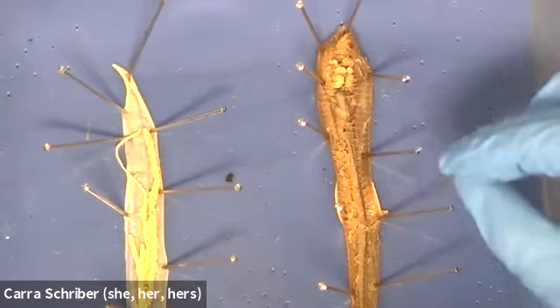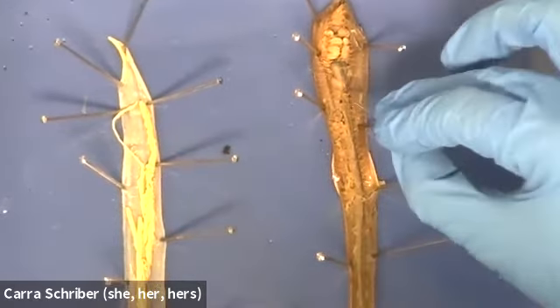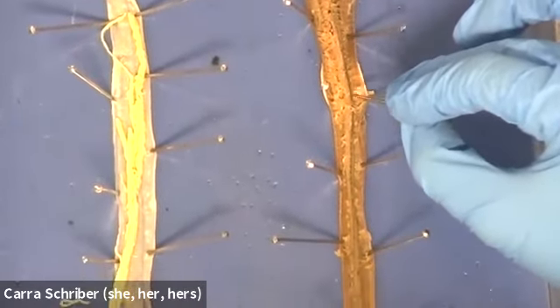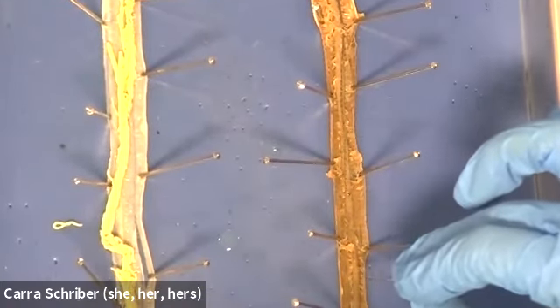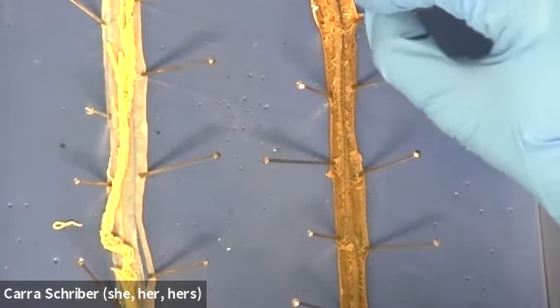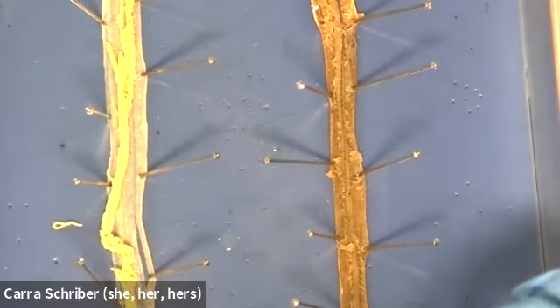digestive organs in general. And then the other thing I wanted to point out is, can you see this line, this dark line that goes along the length of the intestine? This is actually the dorsal blood vessel. So the blood vessel is going to go down on top of the length of the digestive system in the earthworm.